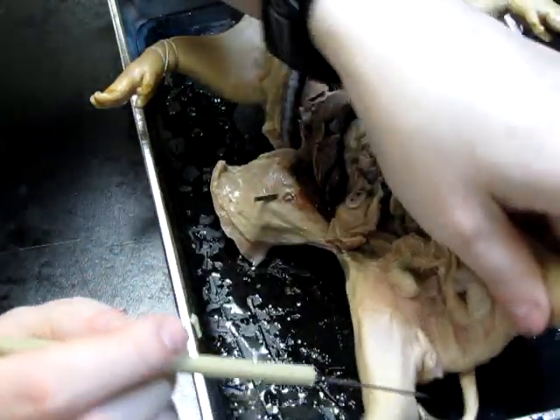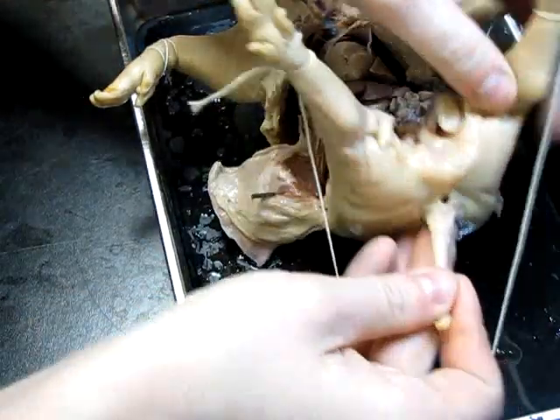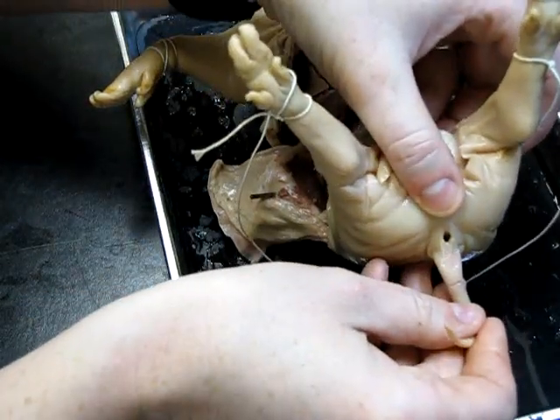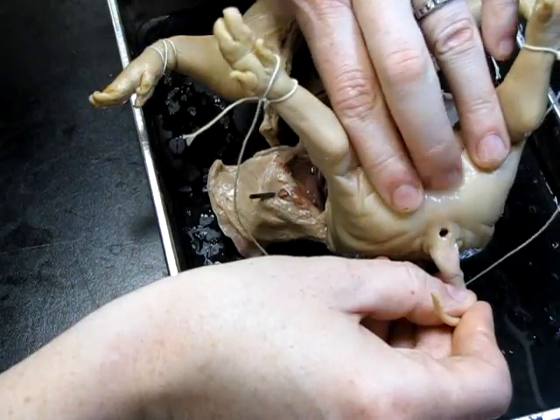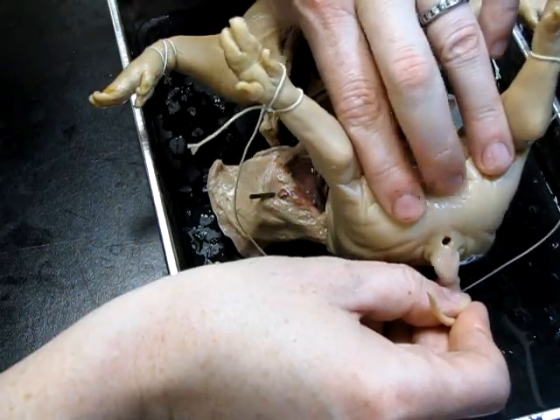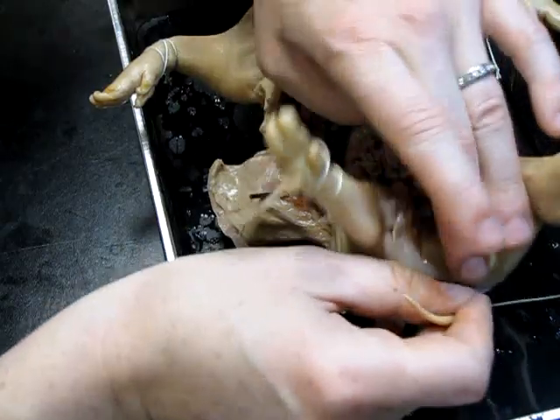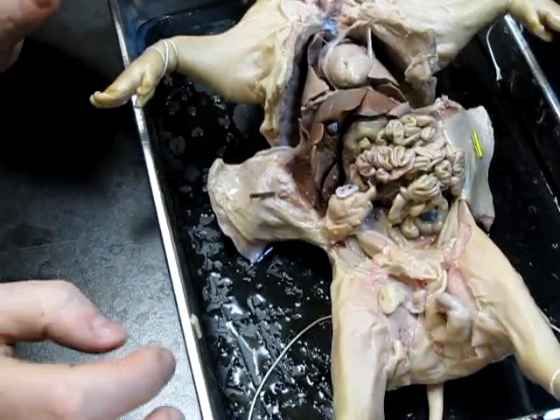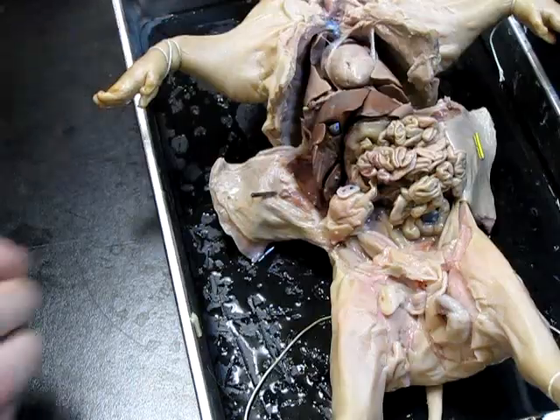I'm going to point this out because it looks different in the female. The anus opening is of course just at the base of the tail, and you'll see that there's no other genital opening above or below the anus. So that is a male fetal pig. Let's have a quick look at the female.